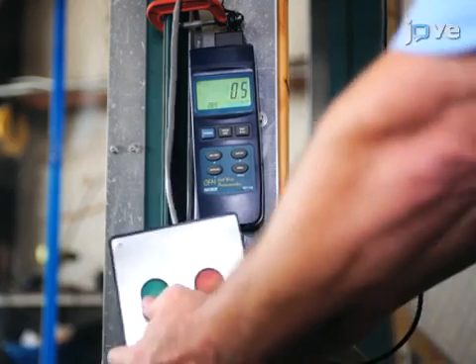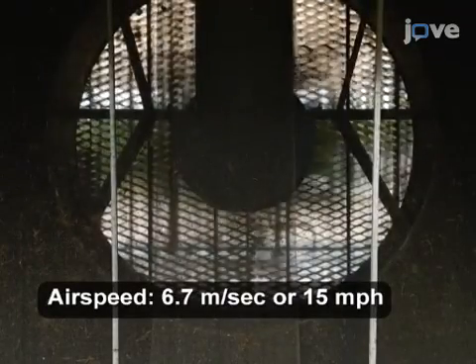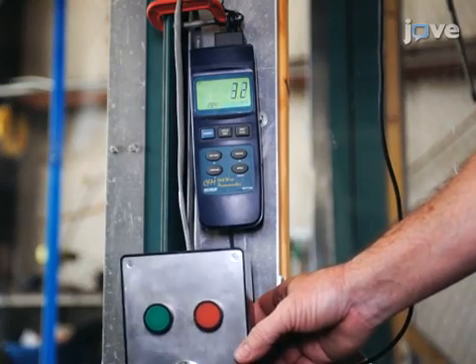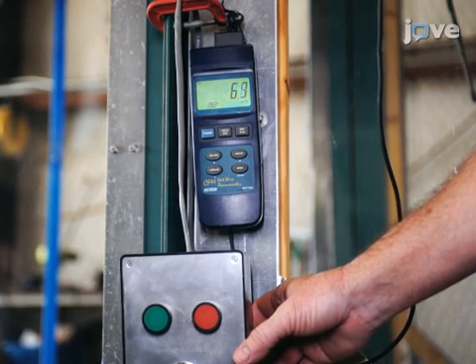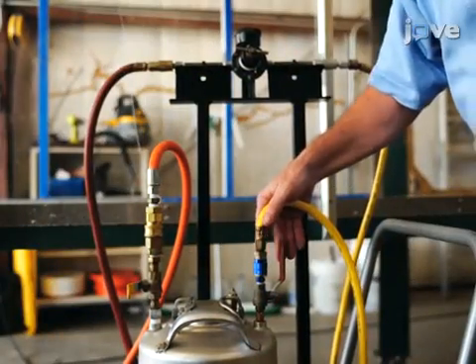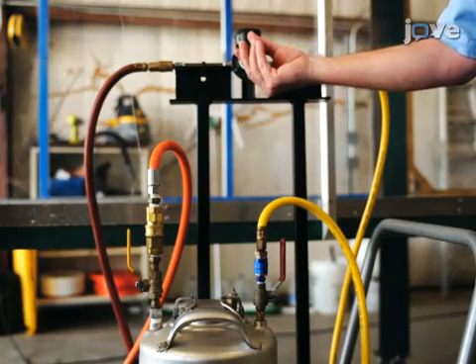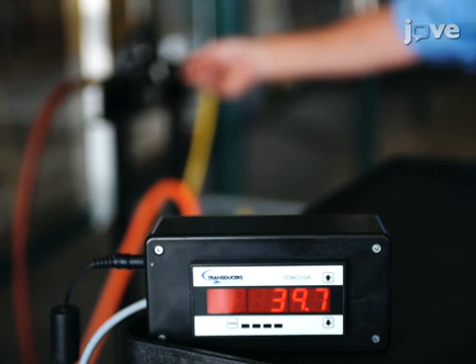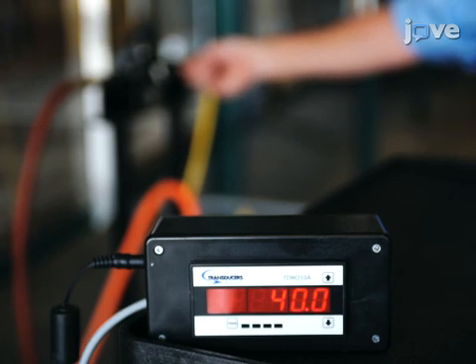The next step is to turn on the wind tunnel and set the airspeed to 6.7 meters per second. Confirm the airspeed independently, as is done here with a reading from a hot wire anemometer inside the wind tunnel. Now use the inline pressure regulator of the air compressor to set the spray air pressure to 276 kilopascals. Verify the spray pressure using the readout of the electronic pressure gauge near the nozzle.